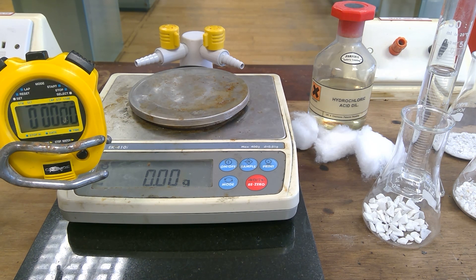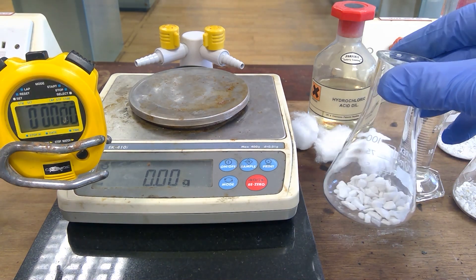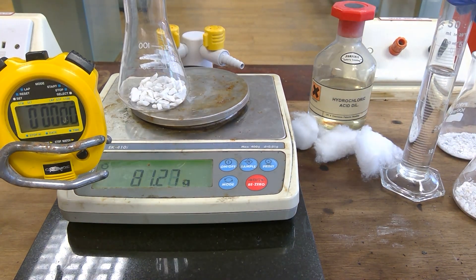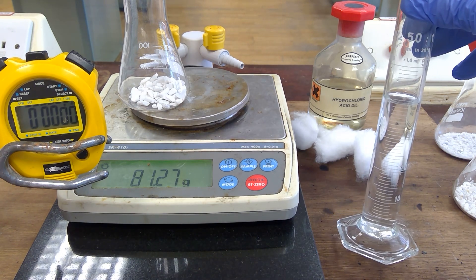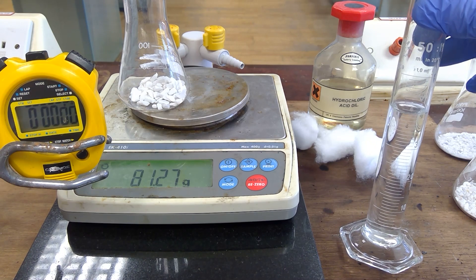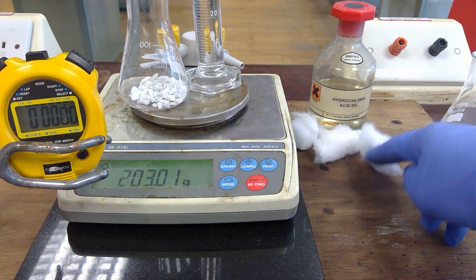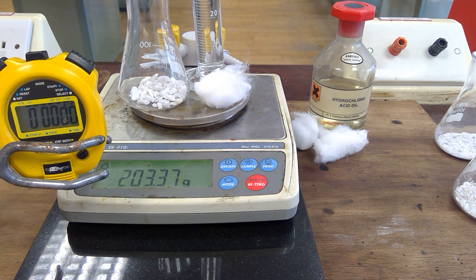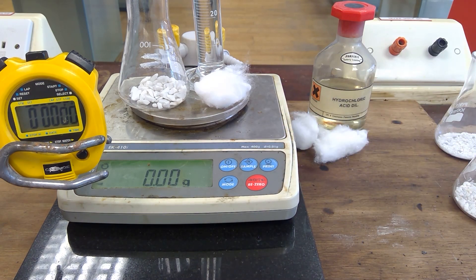The first experiment will use marble chips which have been weighed out to 20 grams, with relatively large marble chips. They will be placed onto the balance. 40 cm cubed of dilute hydrochloric acid of 2.0 moles per cubic decimetre concentration — the same throughout the experiment — is used and is also placed upon the balance. Cotton wool is used to stop any liquid escaping from the conical flask as opposed to the gas. Once everything is on, we press zero and we are ready to go.